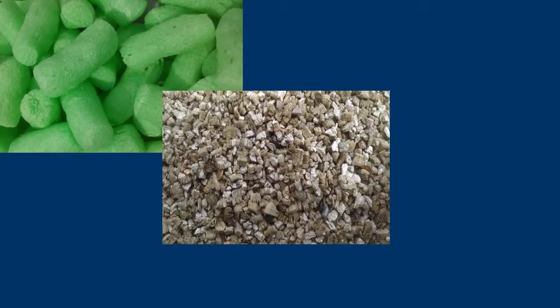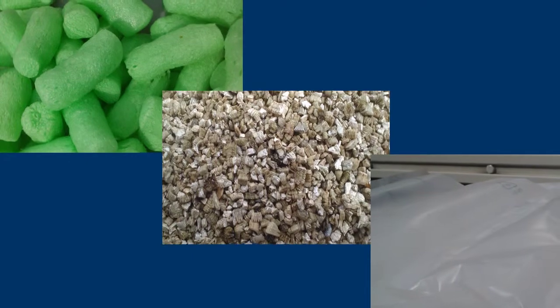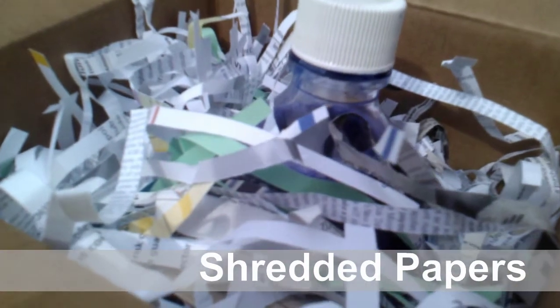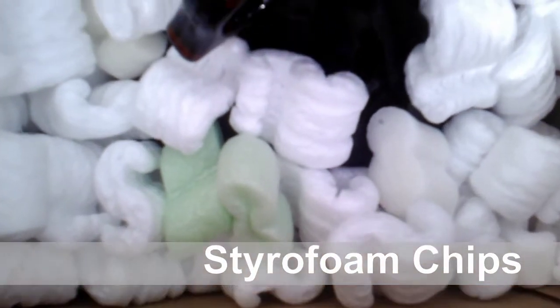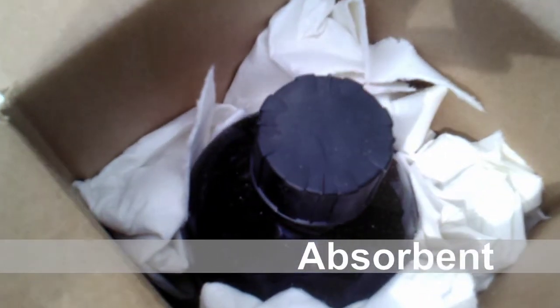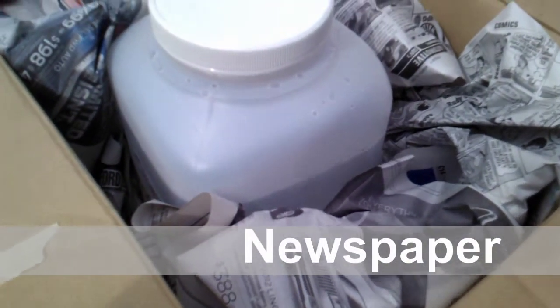We recommend reusing excess shipping supplies like styrofoam, vermiculite, or air pillows. However, you are not restricted to the use of only these packing materials. We have more examples for your reference. The idea here is to fill in the space between the cardboard box and container to create a stable environment. Even crushed newspaper is a perfect solution as packing material.